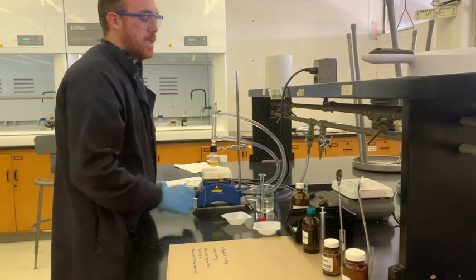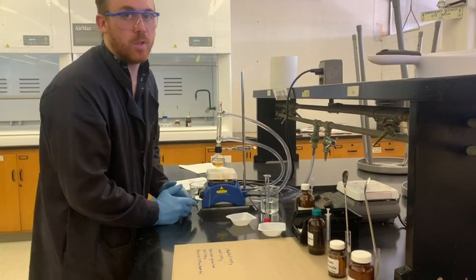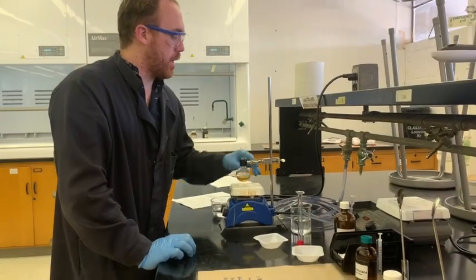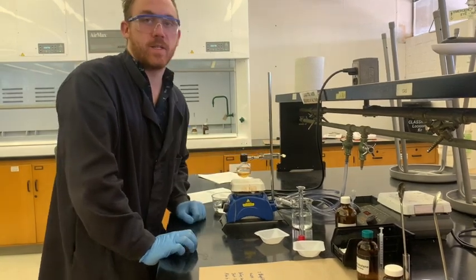You want to always use DI water whenever you're anywhere near this reaction in case something crazy happens and maybe you accidentally spill it with the reaction on. We took off the reflux condenser. You can still leave it on; it's going to be used in a second anyways.